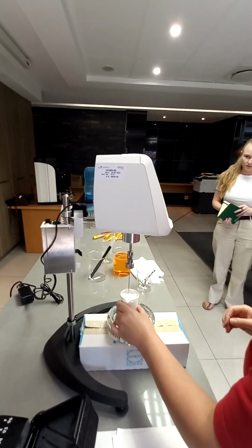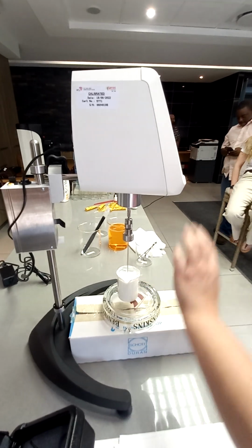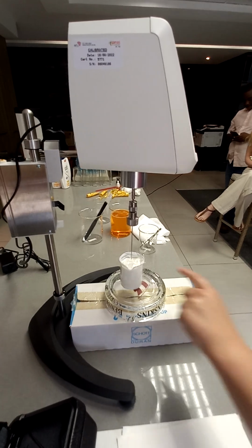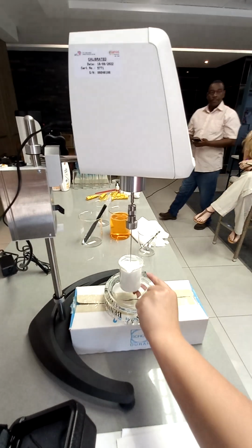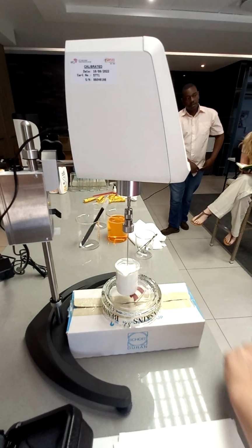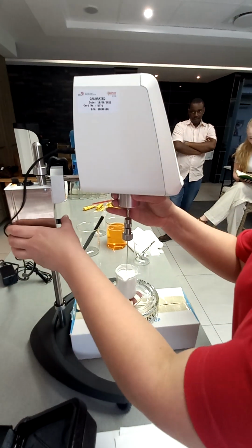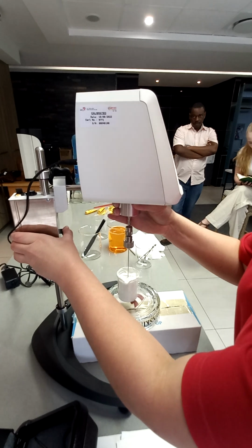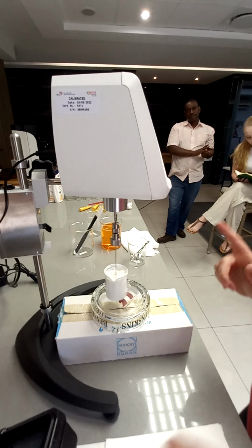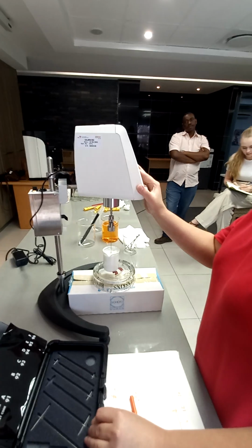Then you'll put your sample. So what we're going to do is start at the top. We're going to lower up to a certain point, and this you need to determine, how far you would like to go in. It's best to take a few values and get an average. There's no mark on that one. There's no mark on this one. We're going to start at the top. I'll just lower it a little bit. You can see we start there. And while that's good, we put spindle number 93.